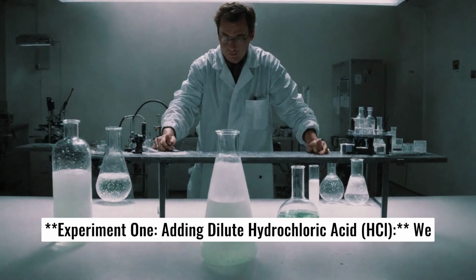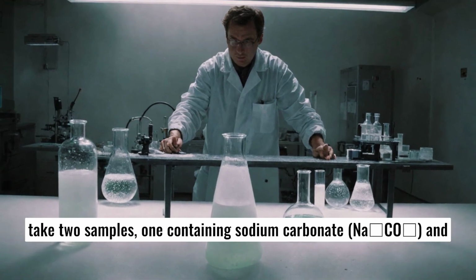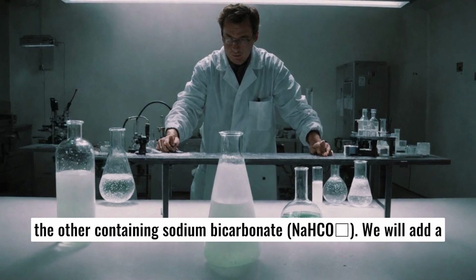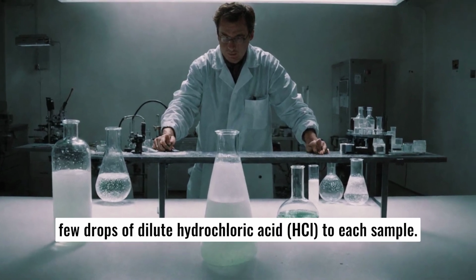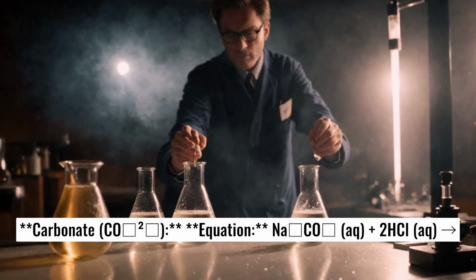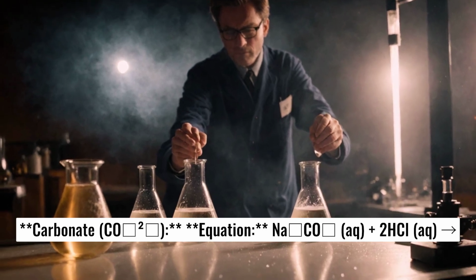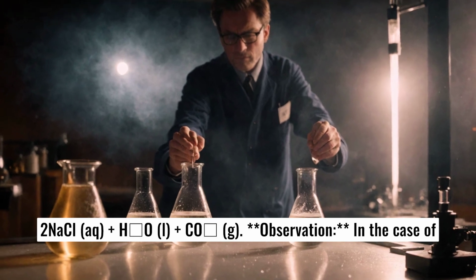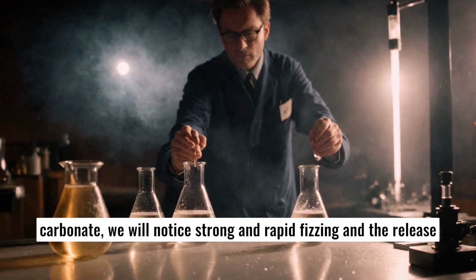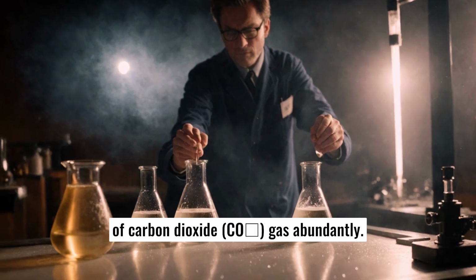Experiment 1. Adding dilute hydrochloric acid, HCl. We take 2 samples, one containing sodium carbonate, Na2CO3, and the other containing sodium bicarbonate, NaHCO3. We will add a few drops of dilute hydrochloric acid, HCl, to each sample. Carbonate. Equation: Na2CO3(aq) + 2HCl(aq) → 2NaCl(aq) + H2O(l) + CO2(g). Observation in the case of carbonate: we will notice strong and rapid fizzing and the release of carbon dioxide, CO2 gas abundantly.